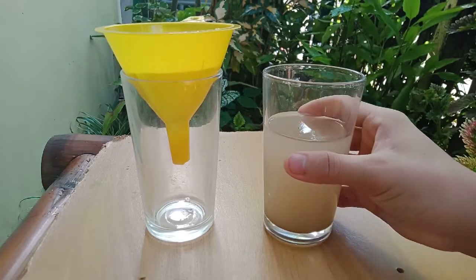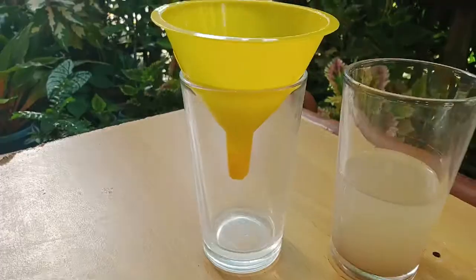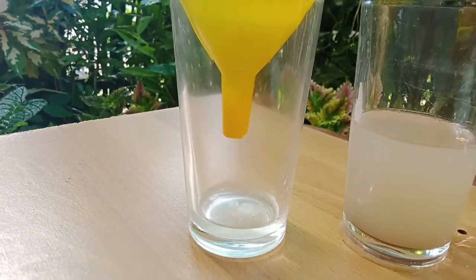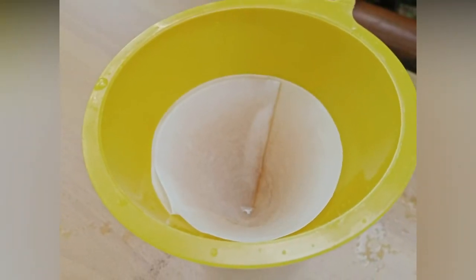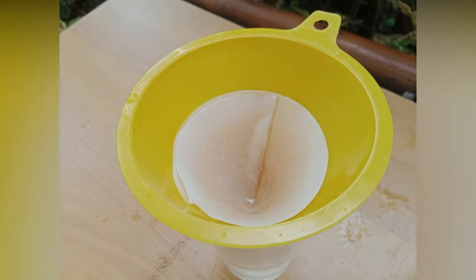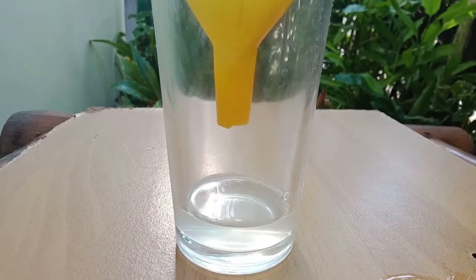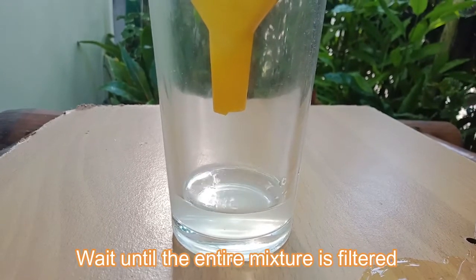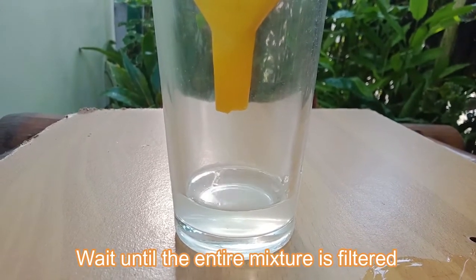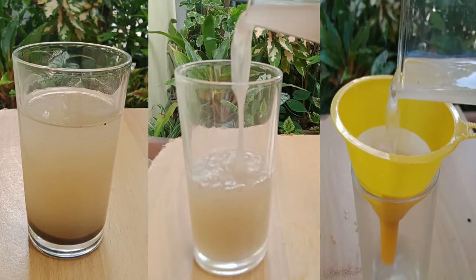After that, we are now going to pour the water mixed with small sand particles into the funnel and filter paper. The sand particles that you can see in the filter paper is called residue, while the filtered water is called filtrate. So now, we are going to wait until the entire mixture is filtered. One eternity later. So after sedimentation, decantation, and filtration, this is now the result.